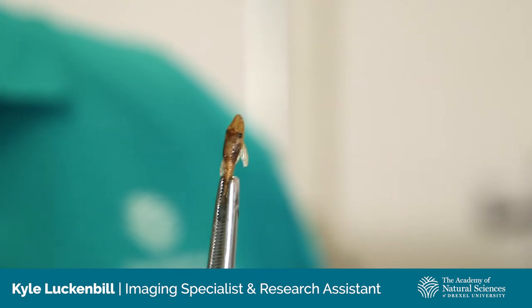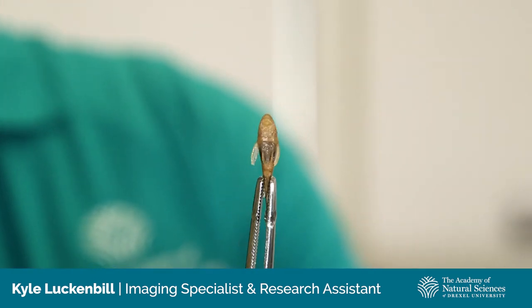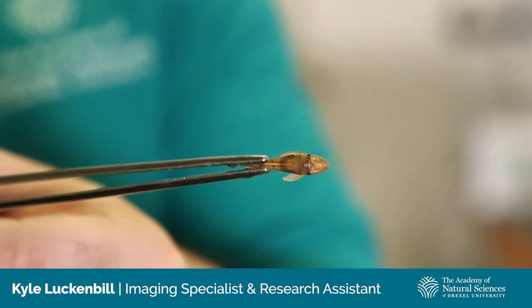Now we're in our photo lab and x-ray lab. One of the easiest ways that we can share our specimens with other researchers, especially those that can't make it here to the academy, is to shoot photographs and take x-rays. With a photograph, they can look at all the external morphology — the characteristics on the outside of the fish — and as long as we've got a scale in there, they can also potentially do some measurements. They can also use a radiograph to look at some of the bones, count vertebrae, count fin rays, and get a lot of valuable information out of the specimens that way.